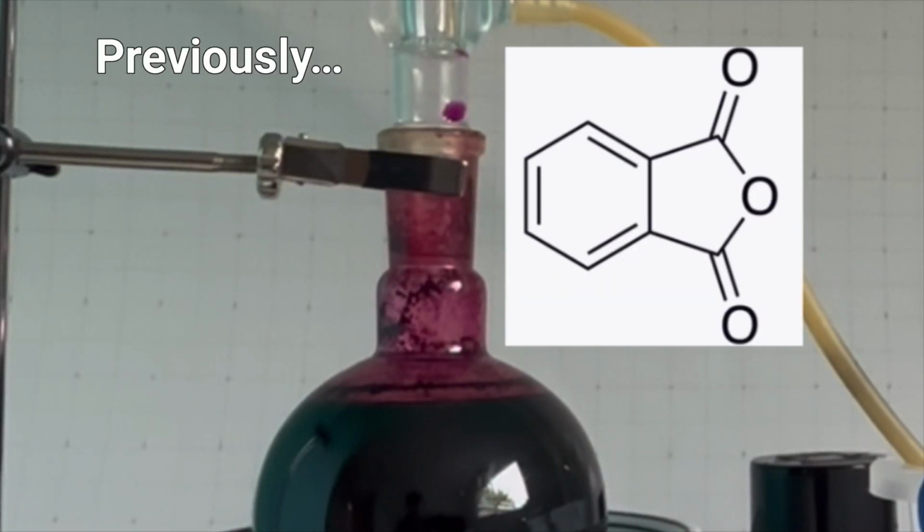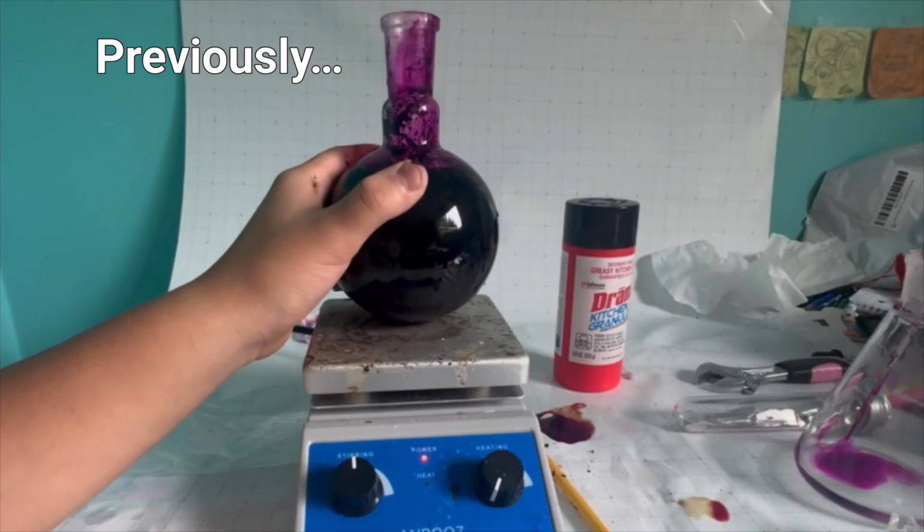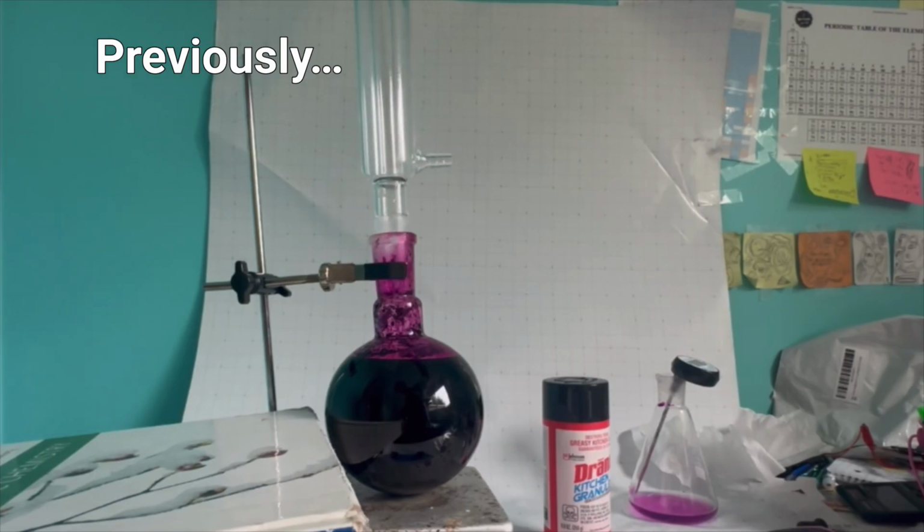Phthalic anhydride is a very important chemical in the industry. I got myself a source of naphthalene. I also introduced a stand and a reflux condenser.